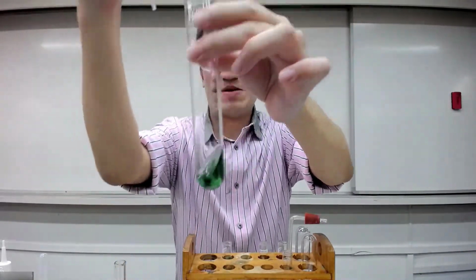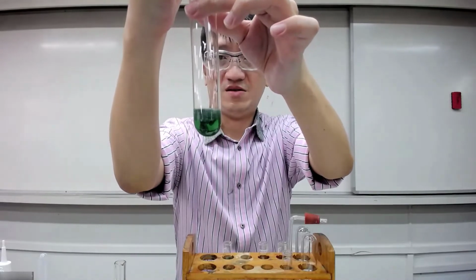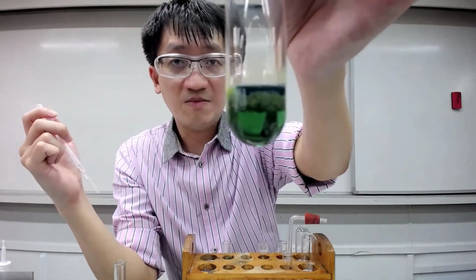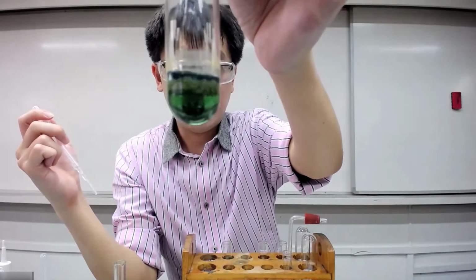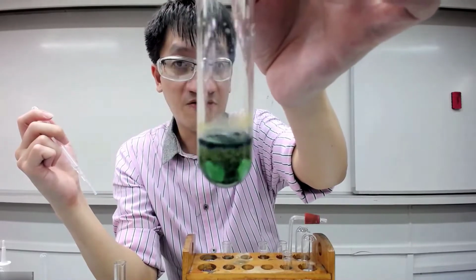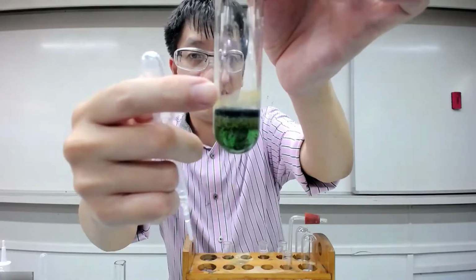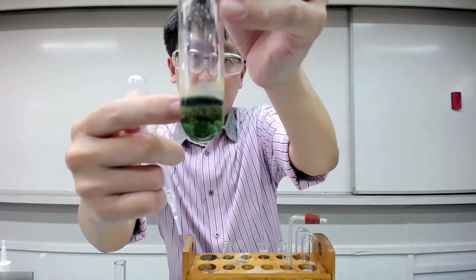Okay, so we're going to add a bit more. Maybe half a bit, just for you to observe. I'm not adding everything. Can you see some, the top layer? Can you see a deep blue solution? And then followed by some at the side along the walls. A bit of reddish brown PPT at the side.